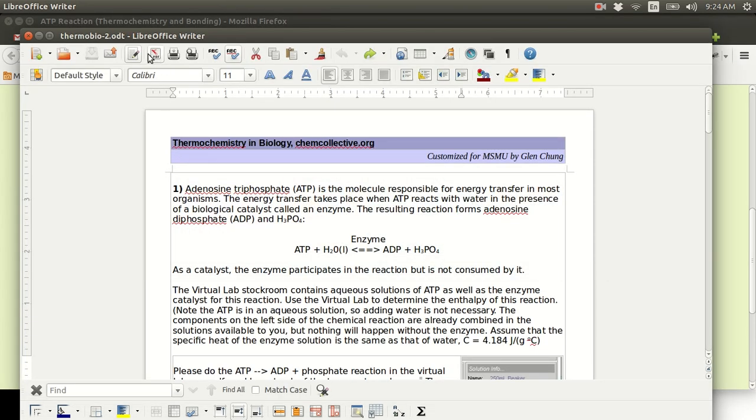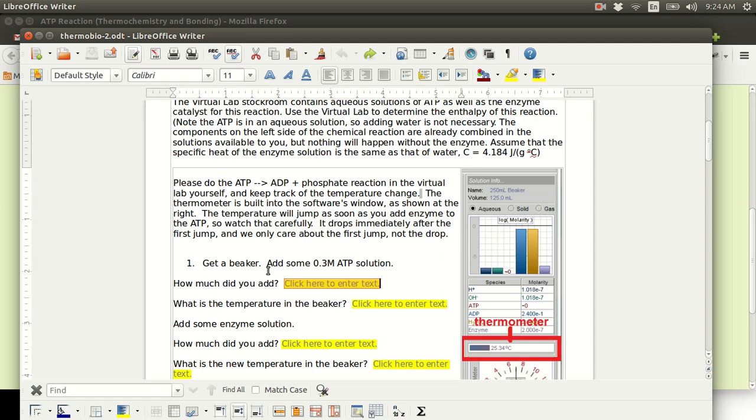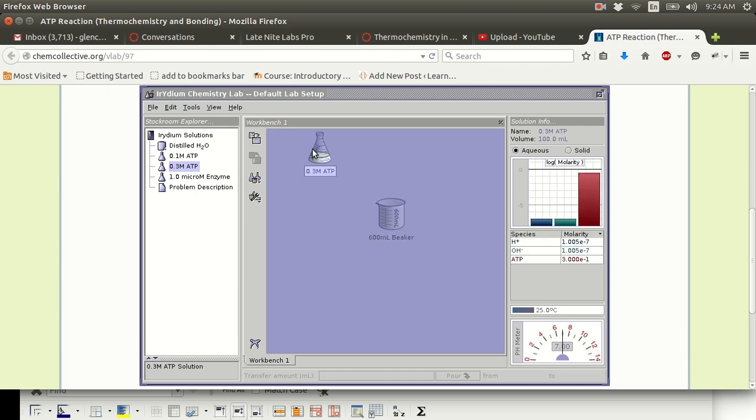I have saved this under a different name on my computer after downloading it in order to be able to edit the file. And I'm about to get a beaker, and I can get them from here. And then I'm going to add some 0.3 molar ATP solution.